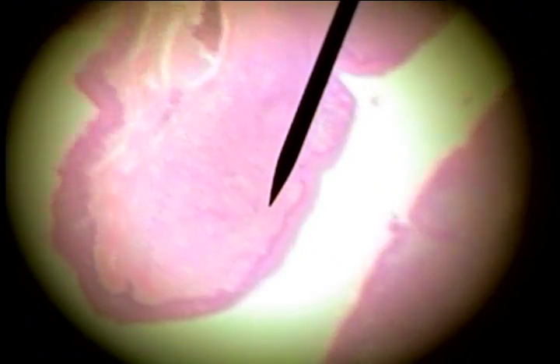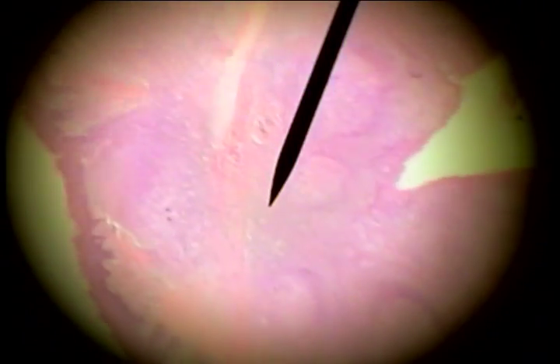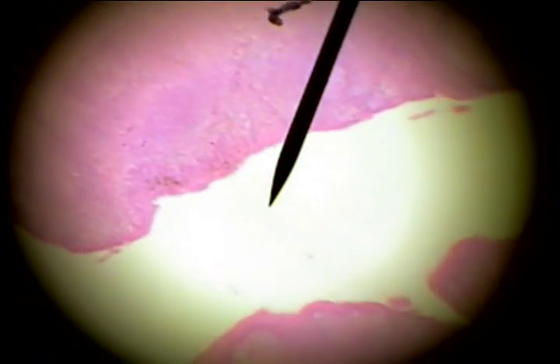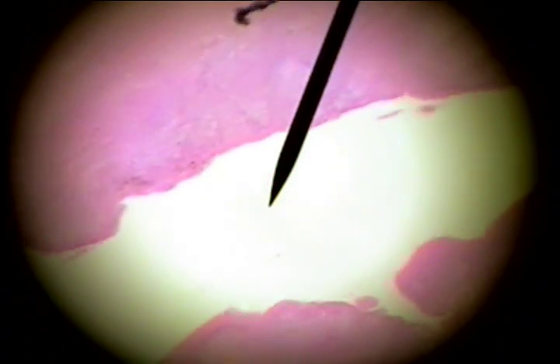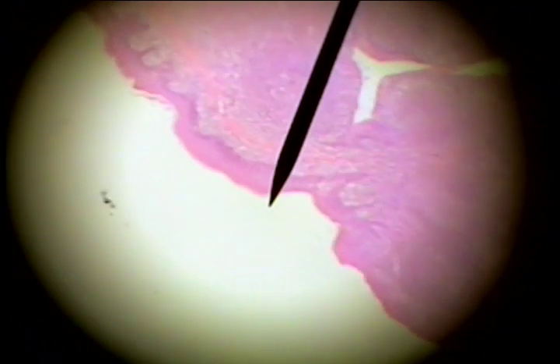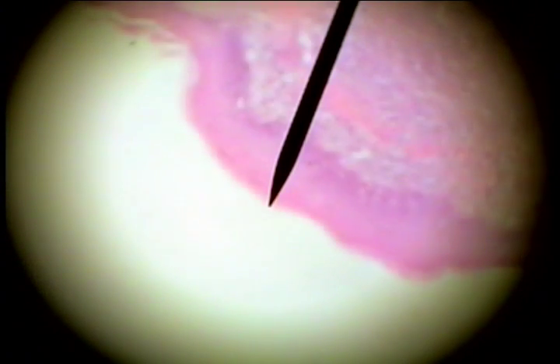And if we scan back, we see an adjacent pit here. If we look at the surface, the epithelium is stratified squamous. And we'll go down to high power.